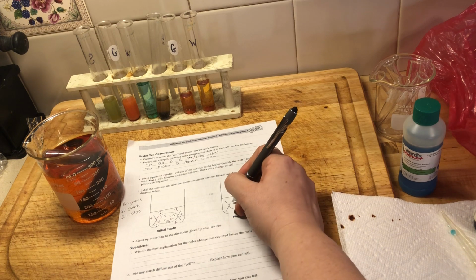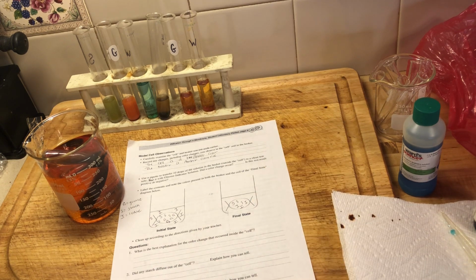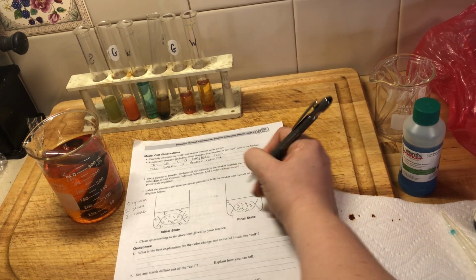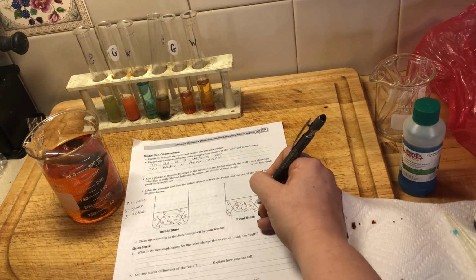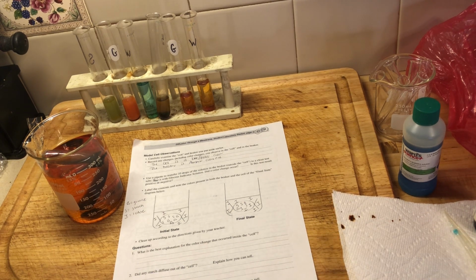Well, we have starch and iodine inside the cell, maybe a couple of glucose, right? So that's where we're at so far, and we still have iodine out in the beaker. So if the iodine moved in, do we think that something might have moved out of the cell and into the beaker? How can we test for that?